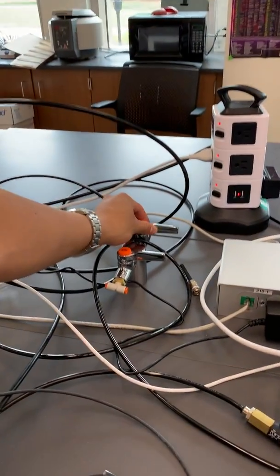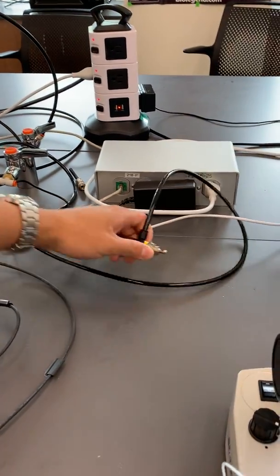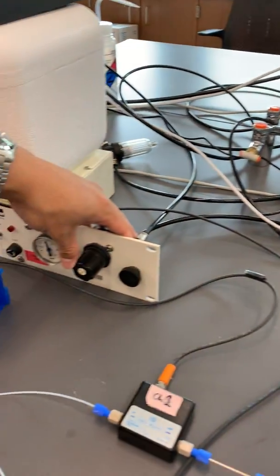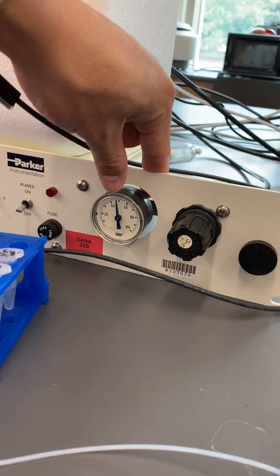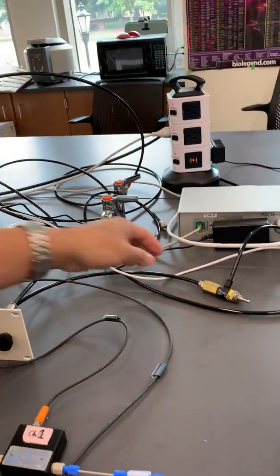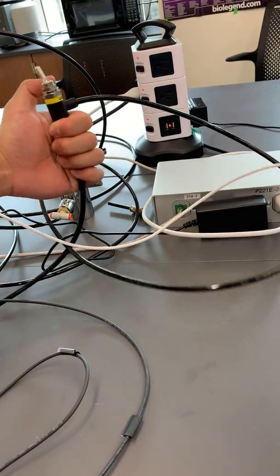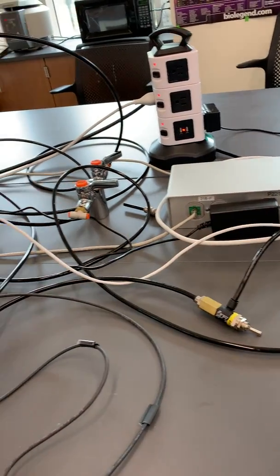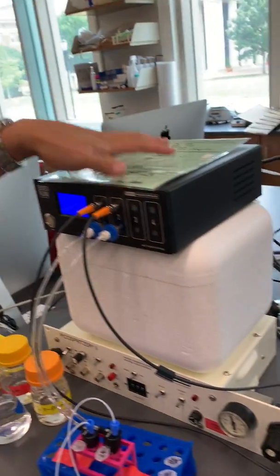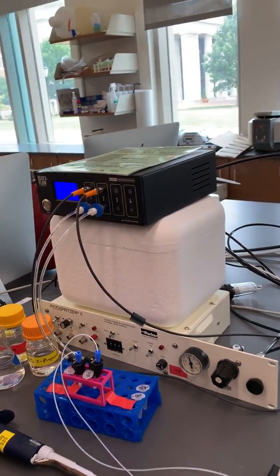And so we're gonna turn this, and when you do that, you should see this needle jump to around 45, 50, which is generally what we see with these. And so it comes out of here into this on-off switch. So we're just going to turn that on, allowing it to flow through the CO2 regulator filter into the box. And so now we have pressure flow.